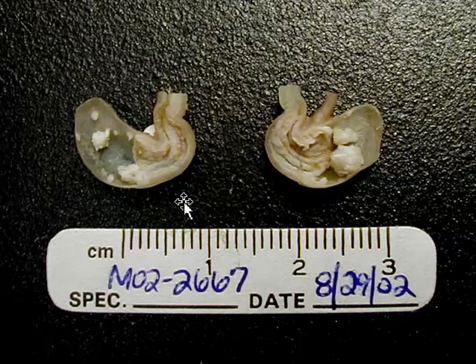Here are multiple gastric papillomas. These may be seen in a number of transgenic strains, especially those whose RAS genes have been mutated. And classically, they have been induced over the years in mice and a number of other species by the administration of a number of carcinogens.